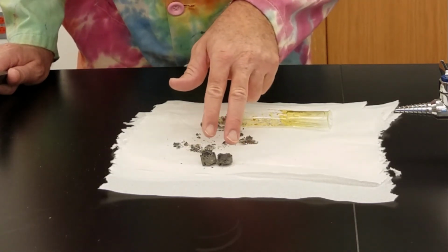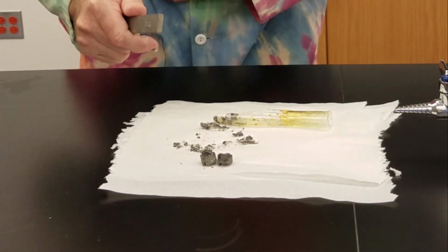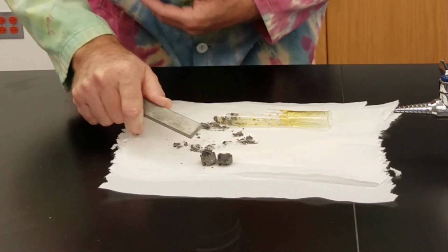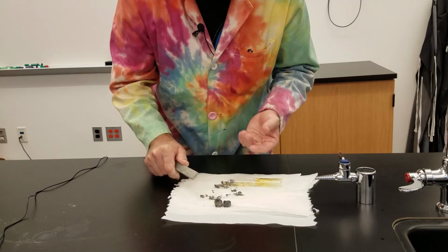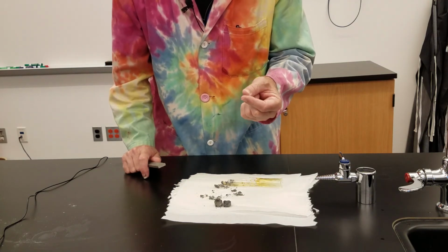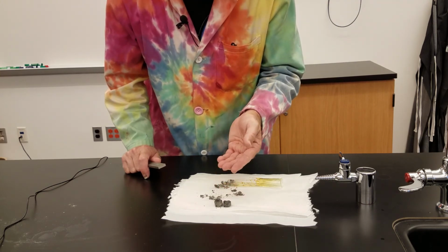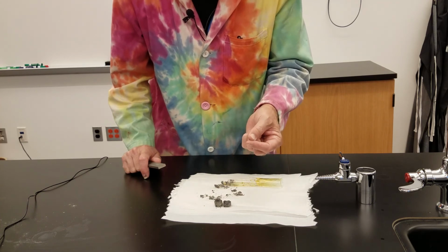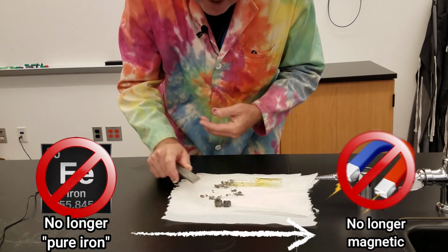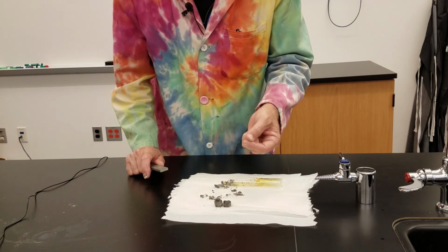Notice the substance has a little bit of a different look to it, but the main thing I want to show you now is if I take our magnet that we used earlier and I run the magnet over top of this, nothing is magnetic. Because when you make a compound, compounds have a different set of properties than the elements that make them up. There's iron inside of here, but it's no longer elemental iron. And the iron that's inside of this compound is no longer magnetic. It has undergone a chemical change. It is now a new substance.